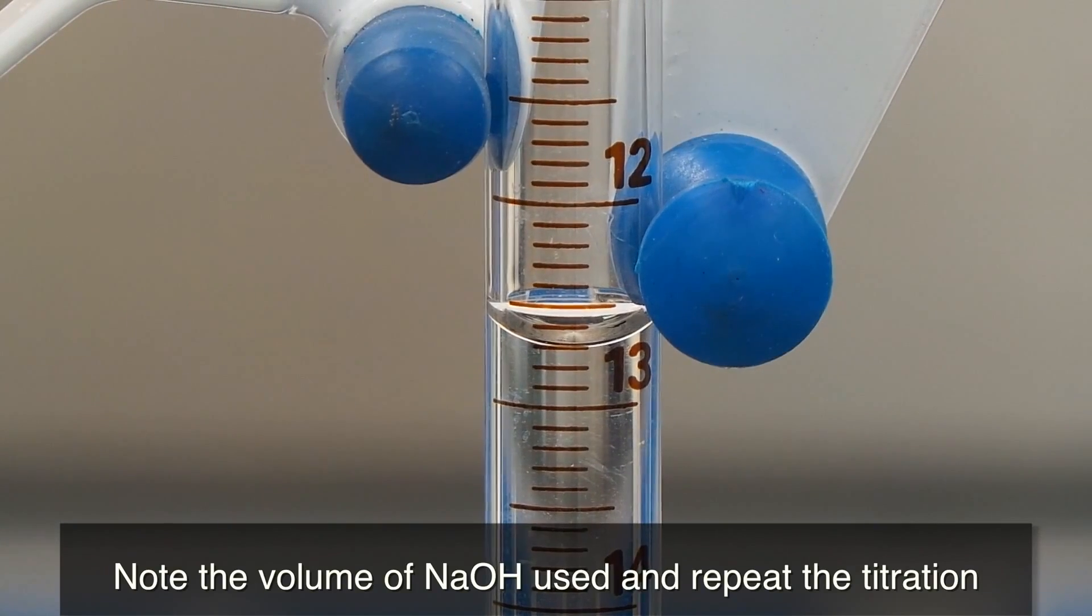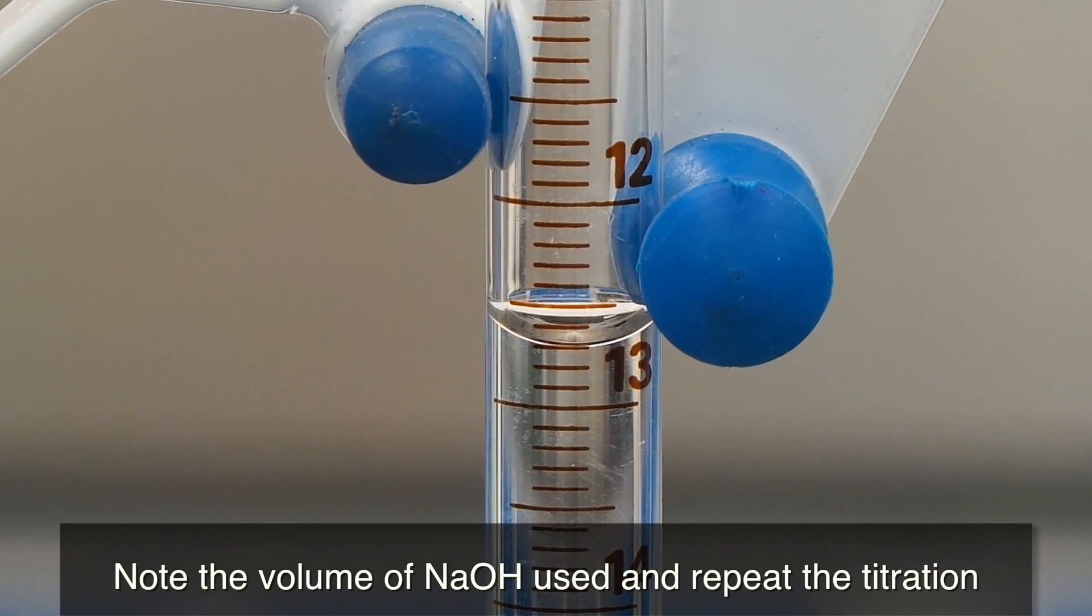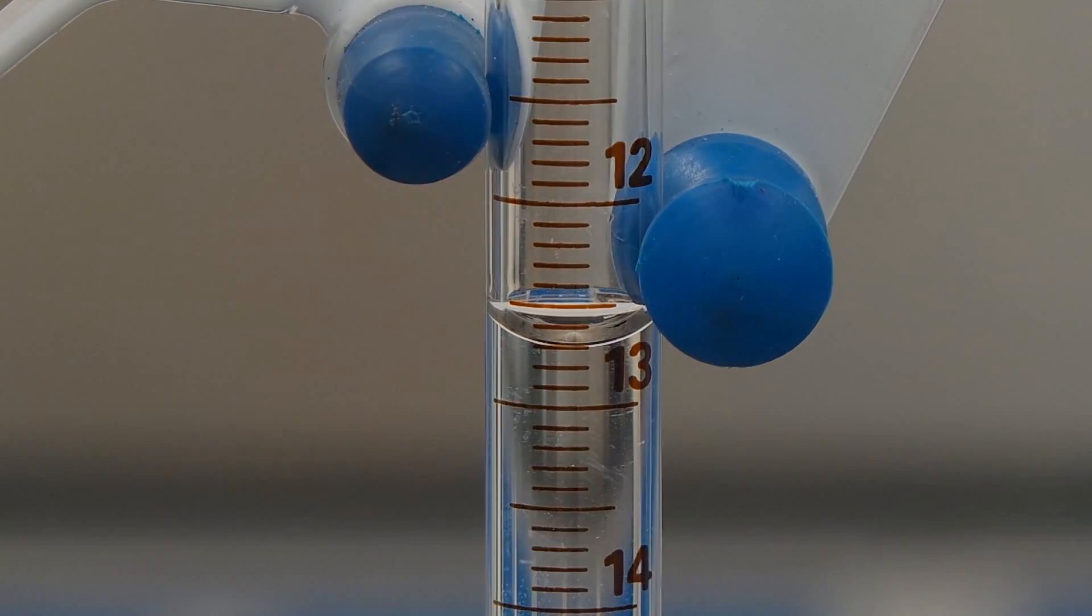Note the volume of NaOH used and repeat the titration. The results for the titration should agree within 0.05 ml.